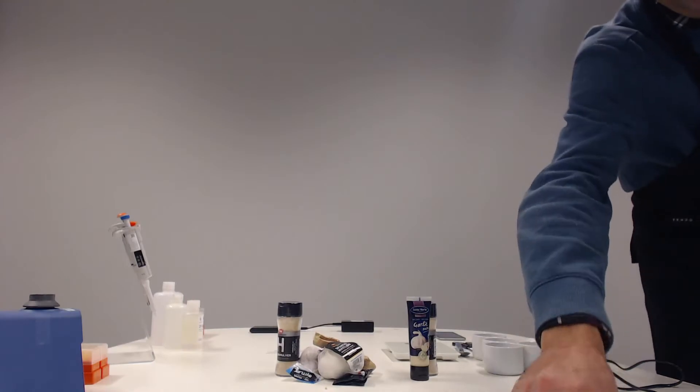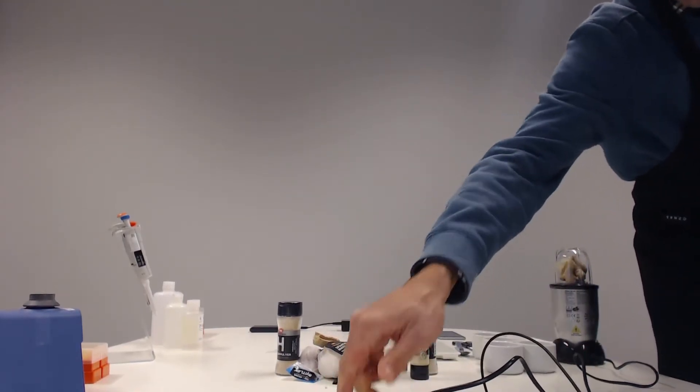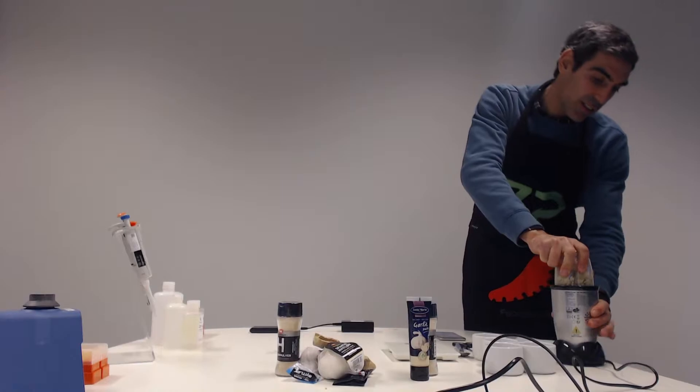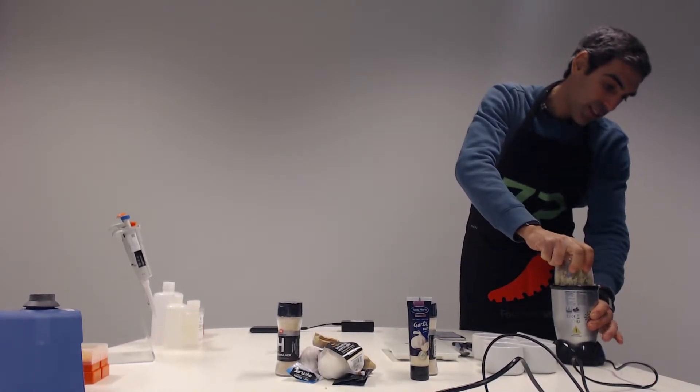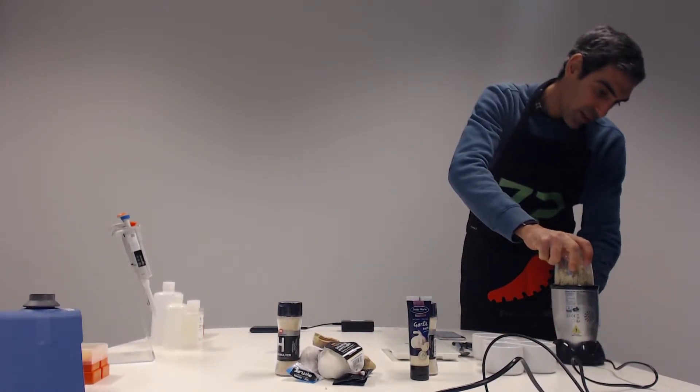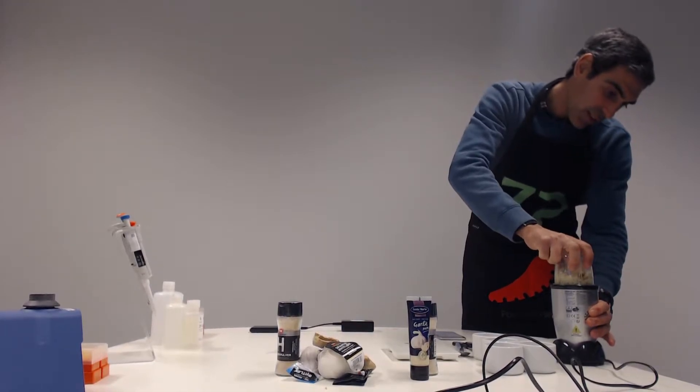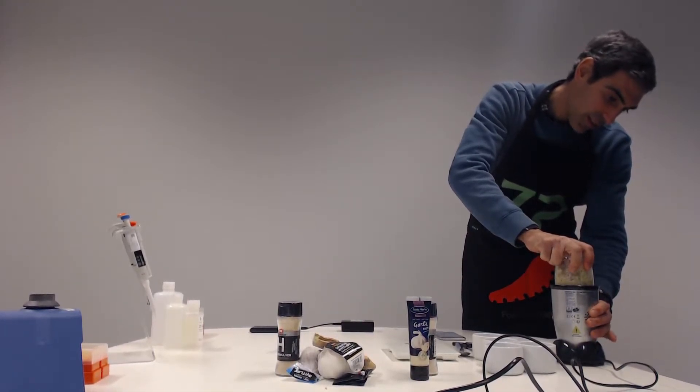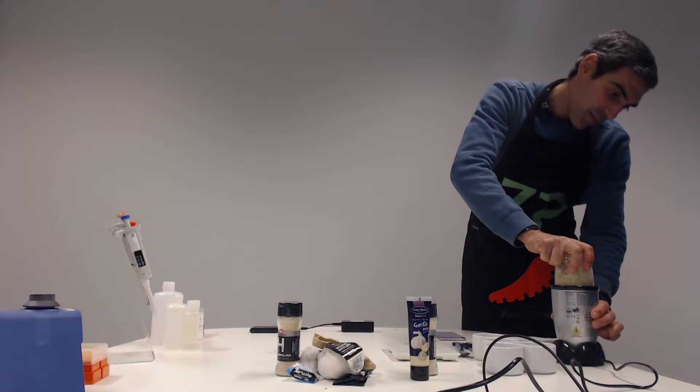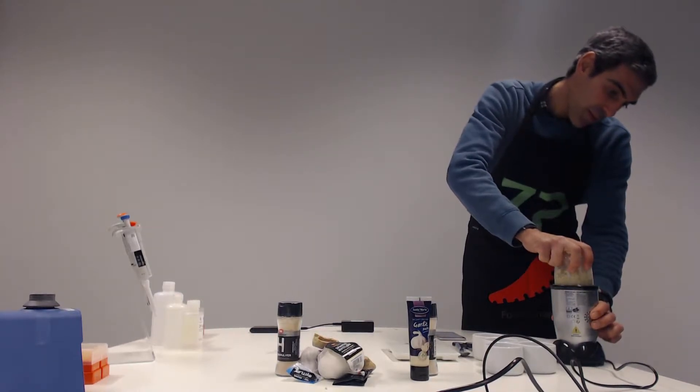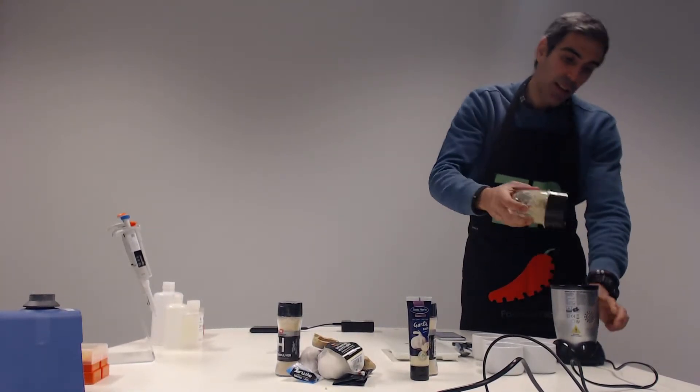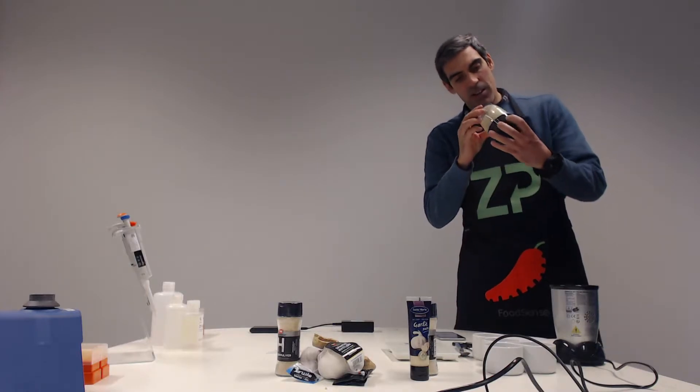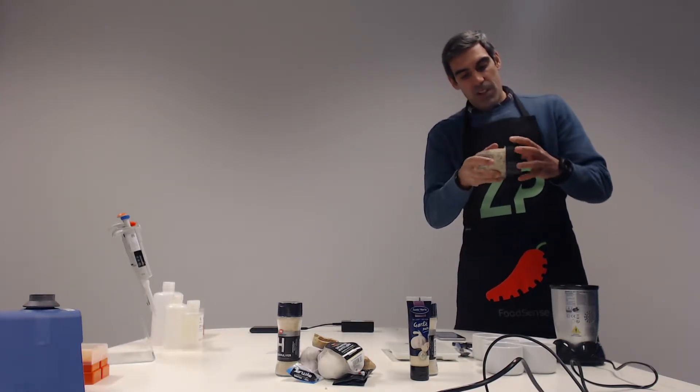Sorry, I will have to plug it in. So let's see how it is now. It looks good.